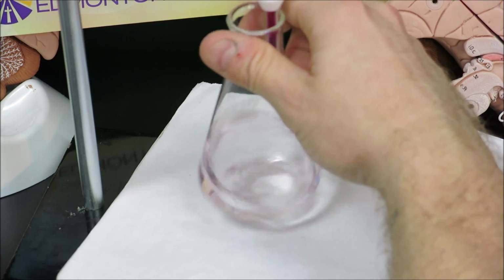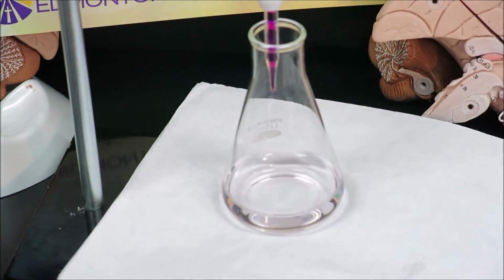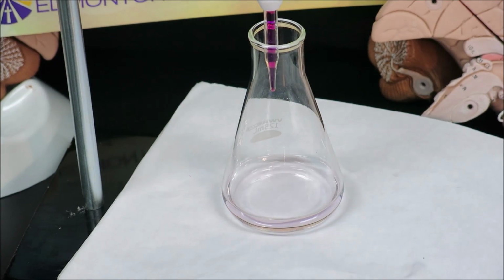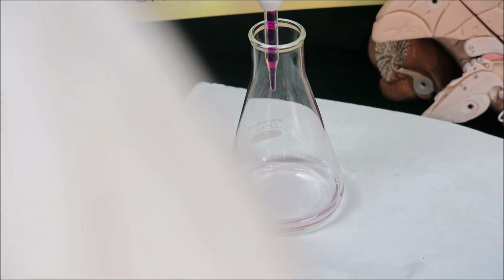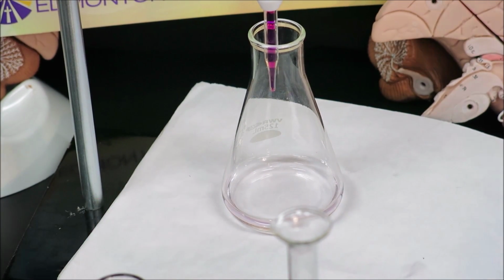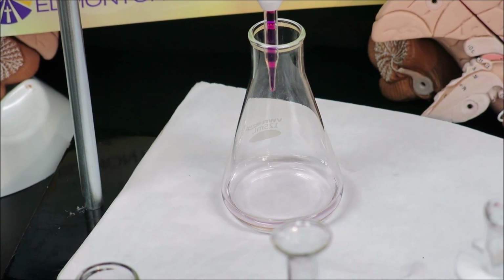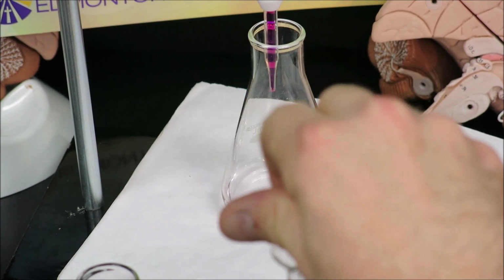and it is remaining pink. Very, very faint pink. Again, might be difficult to see. The easiest technique would be to create our next sample, and that way we can compare to our untitrated color, which would be colorless in this case.